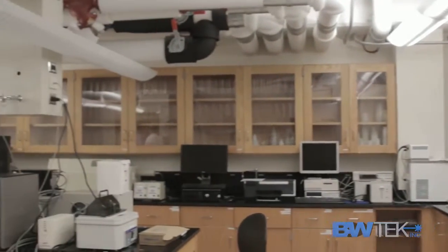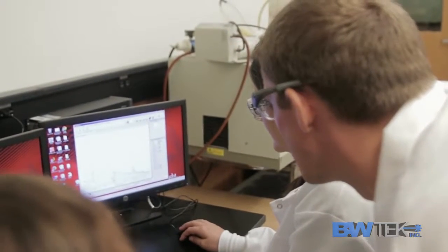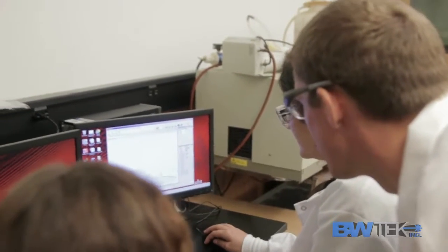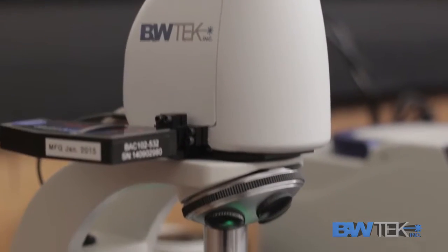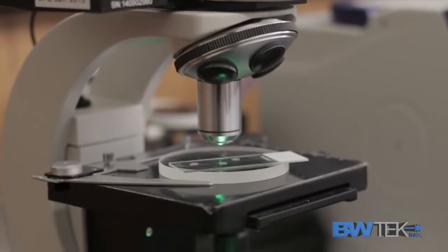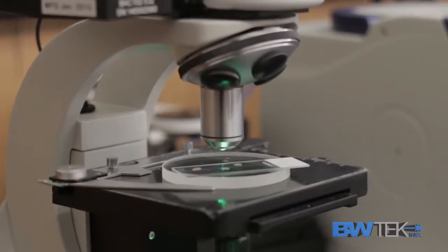So my research has two thrusts. On one hand, I am doing surface-enhanced Raman spectroscopy. I'm looking at some fluctuations that appear in the spectra of single molecules. So I have one student working on that, and then I have another student who is making glassy materials and probing their structural properties using Raman spectroscopy. One of our research projects is using the iRaman Plus to investigate the structural properties of glass.